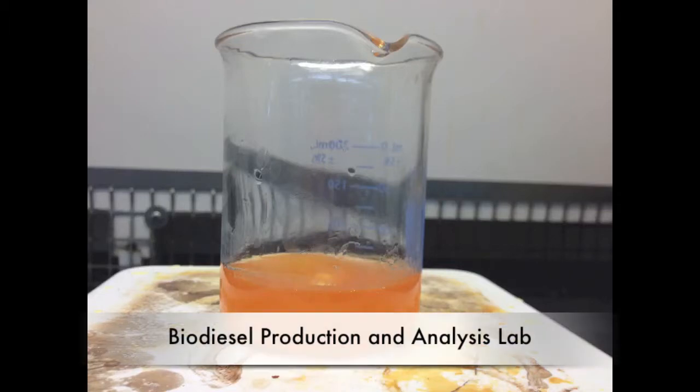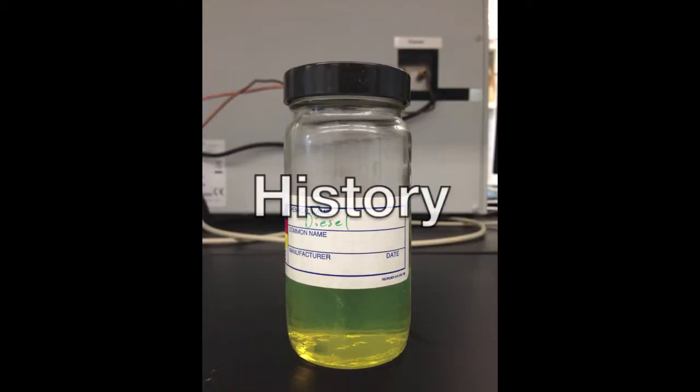Welcome to the biodiesel production and analysis lab video. Let's start with some background on diesel.